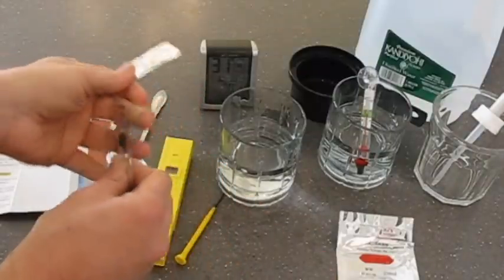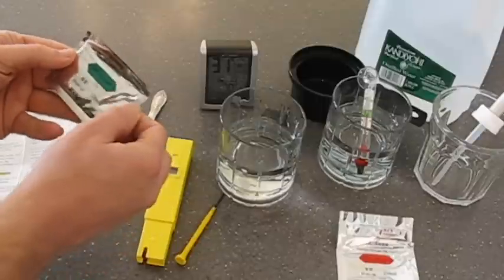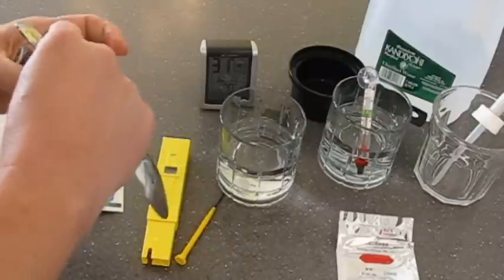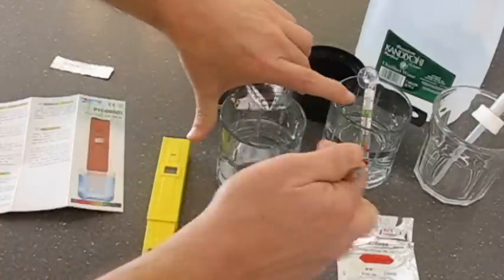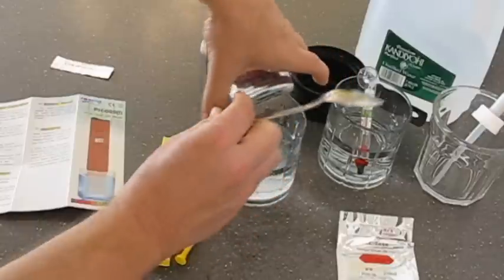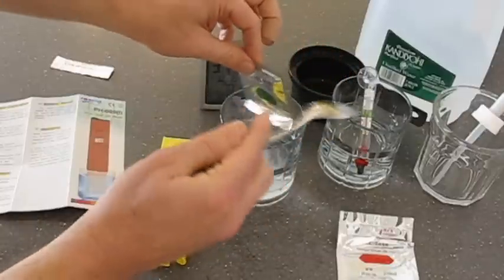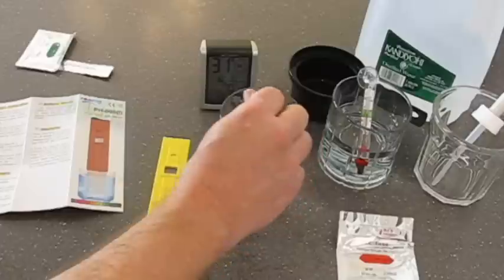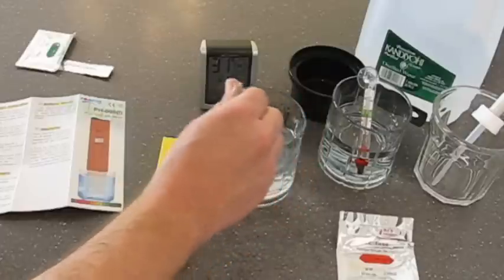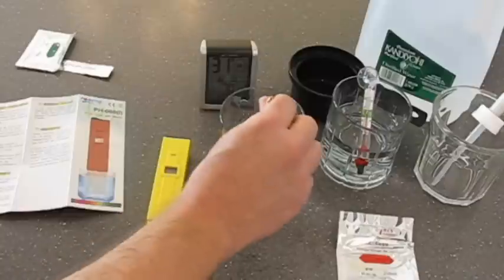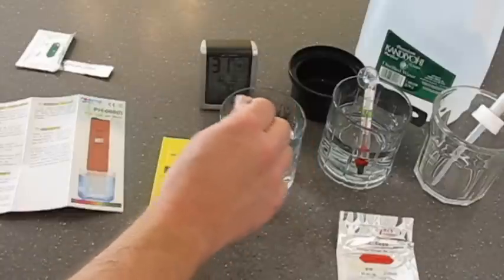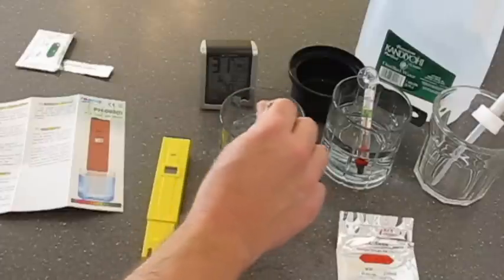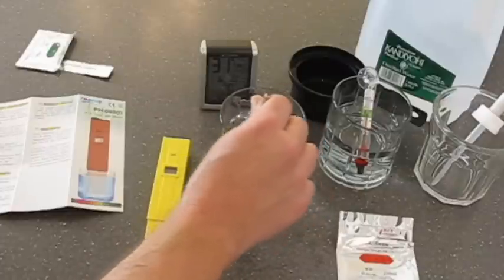I'm going to mix my phosphate powder with one cup of distilled water. And I just bought this gallon of distilled water at the grocery store for 99 cents. I also rinsed my electrode with distilled water, which is in the instructions, and then I blotted it dry with a paper towel.